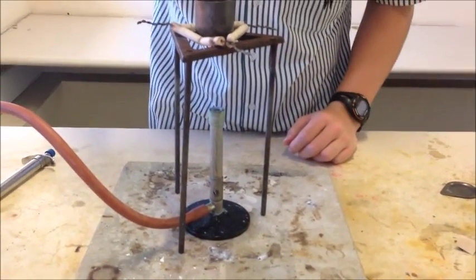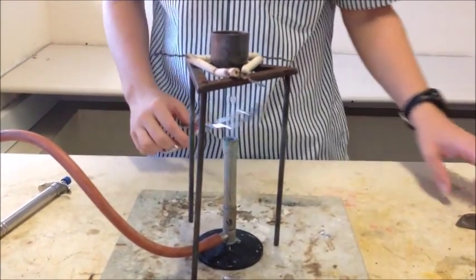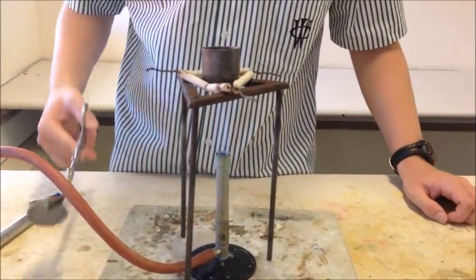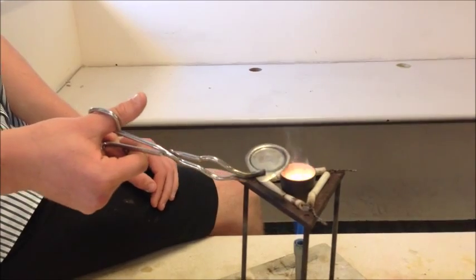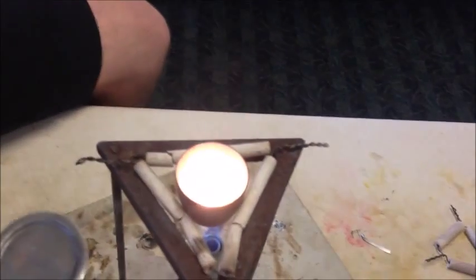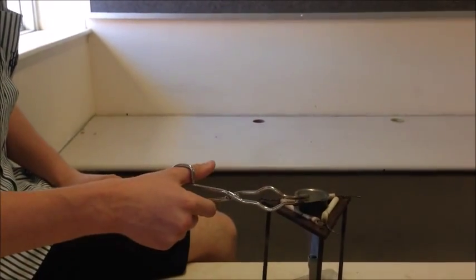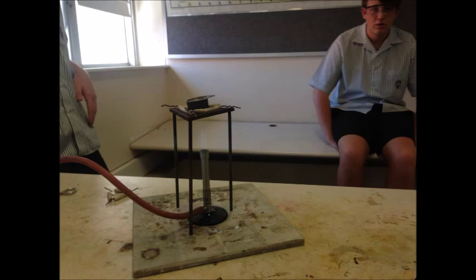You'll know when the reaction occurs because the magnesium ribbon will start to smoke. Once your magnesium ribbon starts to smoke, you're going to want to place the lid over the top. The reaction is now starting to take place as it is smoking. Occasionally lift up the lid to bring oxygen into the reaction. You will see when the reaction has stopped, as the flame will go out and the magnesium will stop smoking. When this happens, turn off the flame and let the crucible cool.